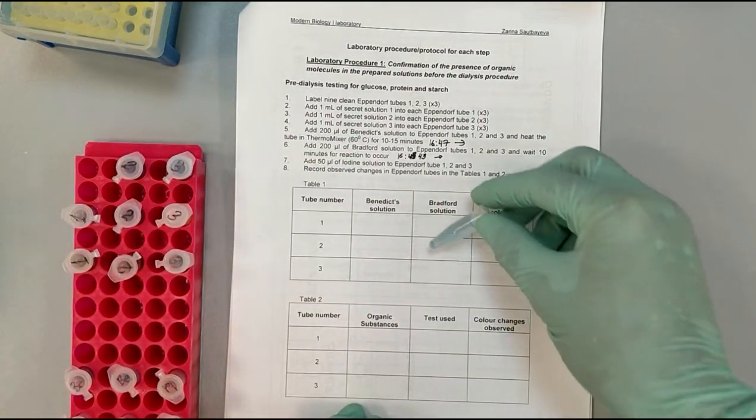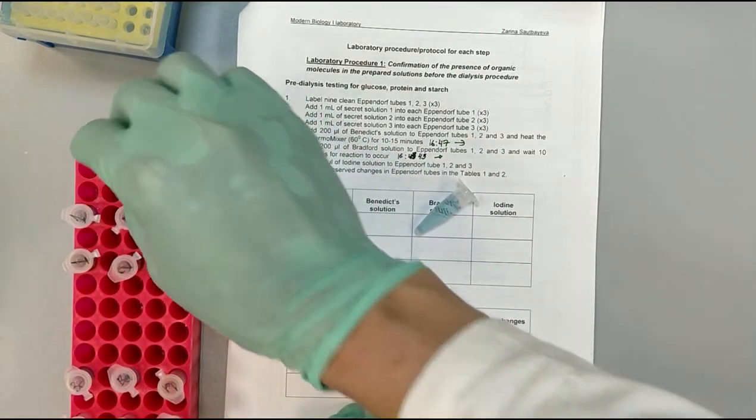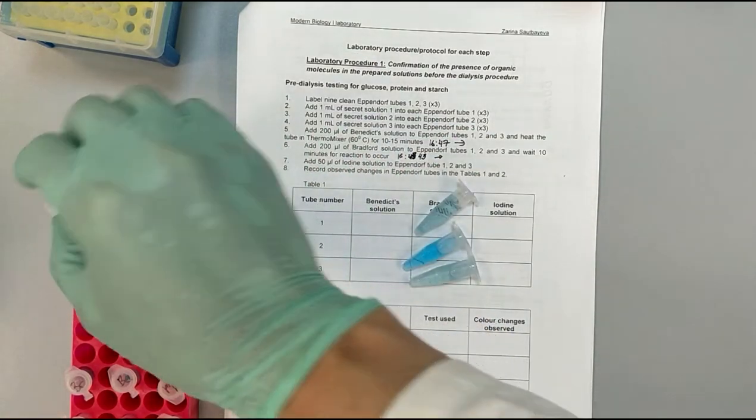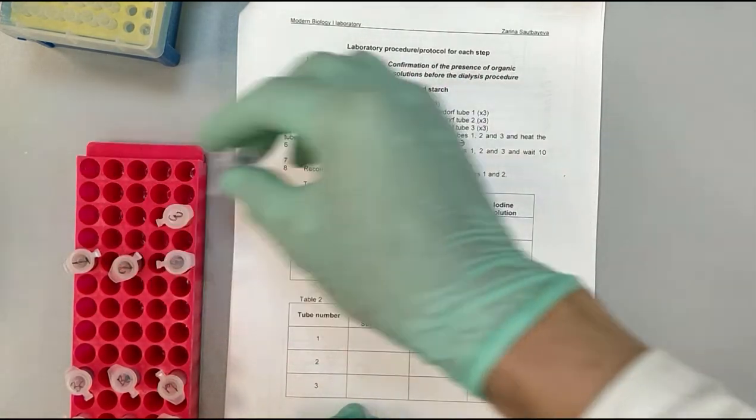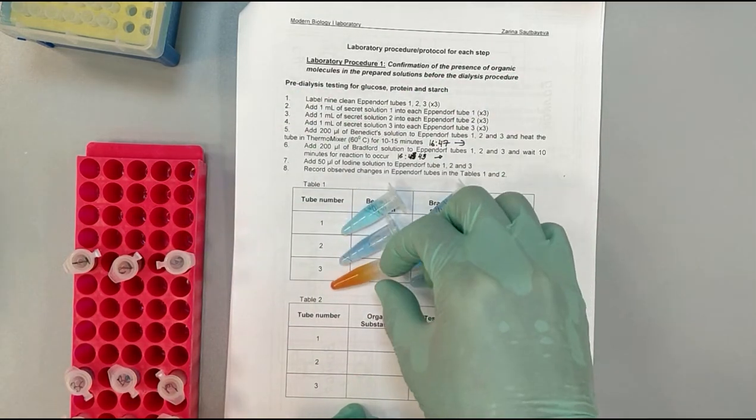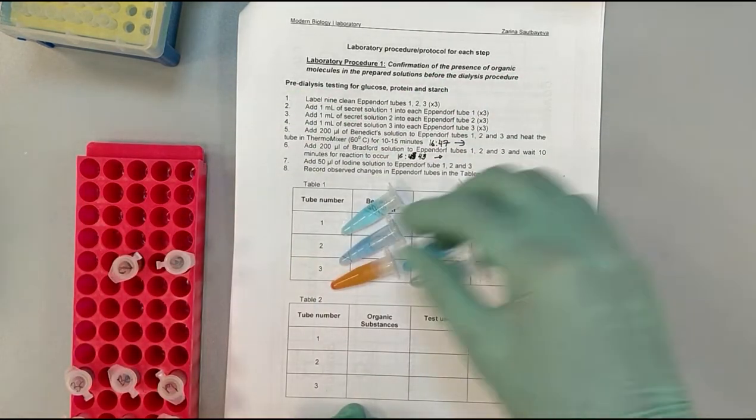So again, we have the Bradford here, like this. Then we have the Benedicts. And finally, we have iodine.